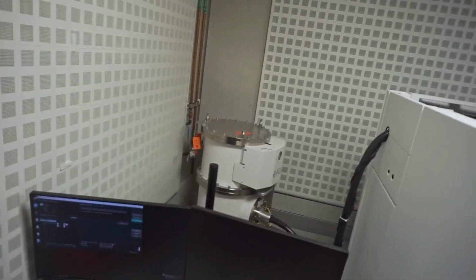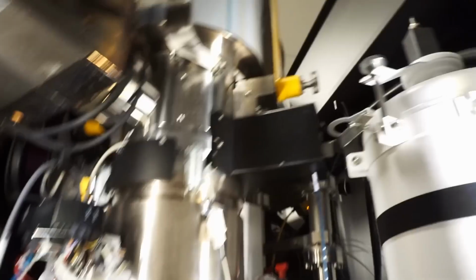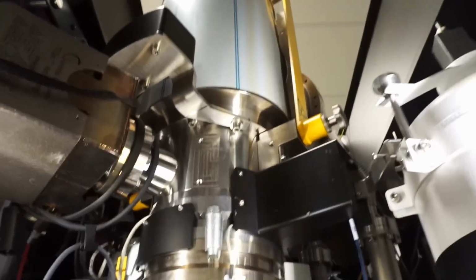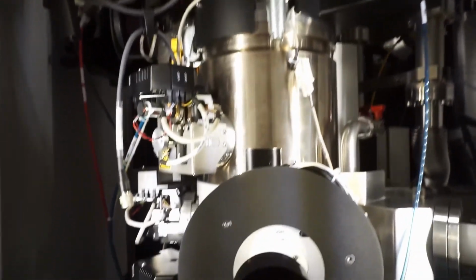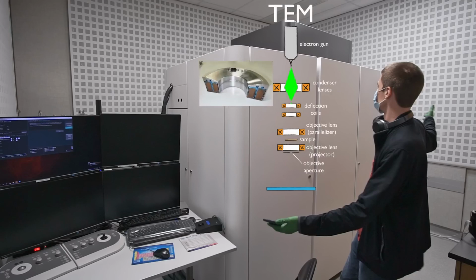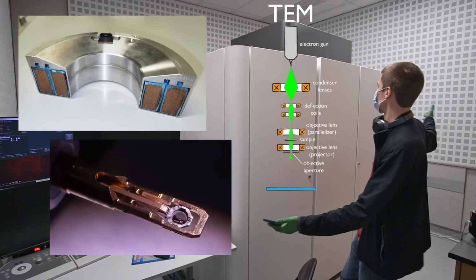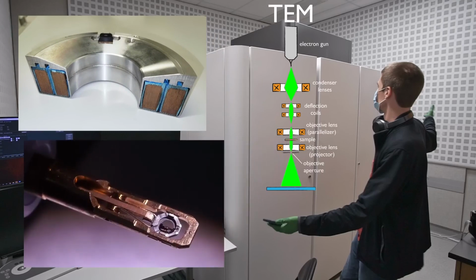Those are our atoms. Just imagine that instead of a flashlight with a pinhole, we have an electron gun powered by a huge high voltage power supply. And instead of glass lenses, we have really big electromagnets that bend that beam of electrons as it's passing through the microscope. Now, compared to our flashlight model, the electron gun is at the top of this system. And it's focused by a series of magnetic lenses capable of bending the electron beam onto the sample, and then through the sample, and then through more lenses that expand that image into a camera.